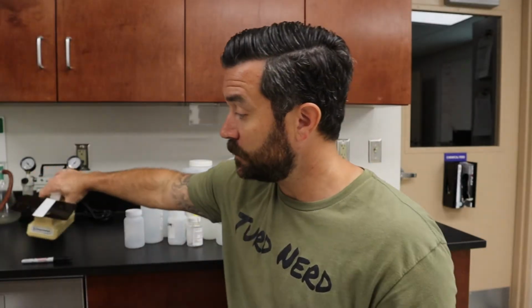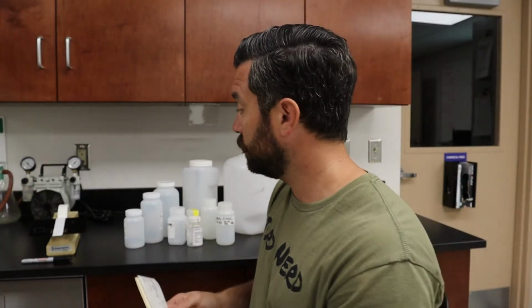We have this old faithful here, tape dispenser. We just write on it with the Sharpie what it is, and if I'm going to be storing it in the refrigerator, then another operator can go in there and know exactly what that sample is. Here at this facility, however, it is a smaller one, so if I'm taking the sample, I'm usually the one running it. You also have stickers you can purchase. You can put them on any of your sample bottles however you want to do it.